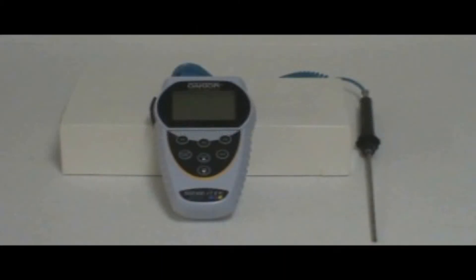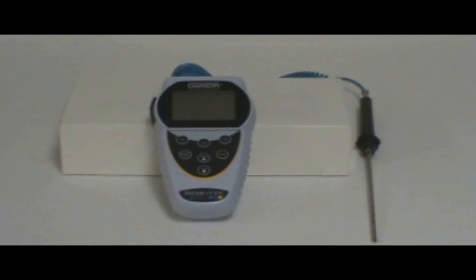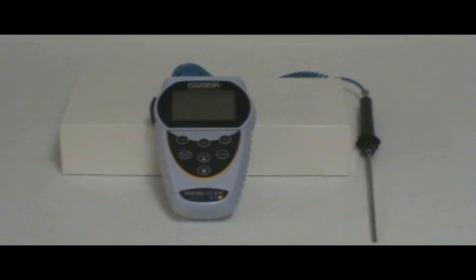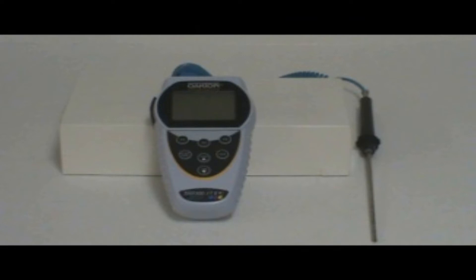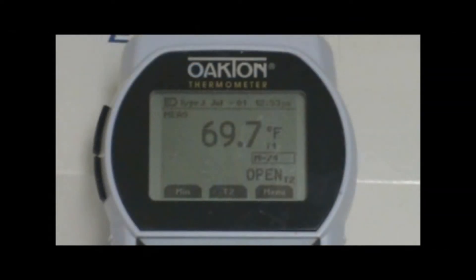Today we will be showing you how to set up your Oakton TEMP 300 thermometer to data log readings and how to download that data to your computer. For this you will need your TEMP 300 meter, a thermocouple probe, a USB cable, a USB driver, and a computer with the program HyperTerminal.